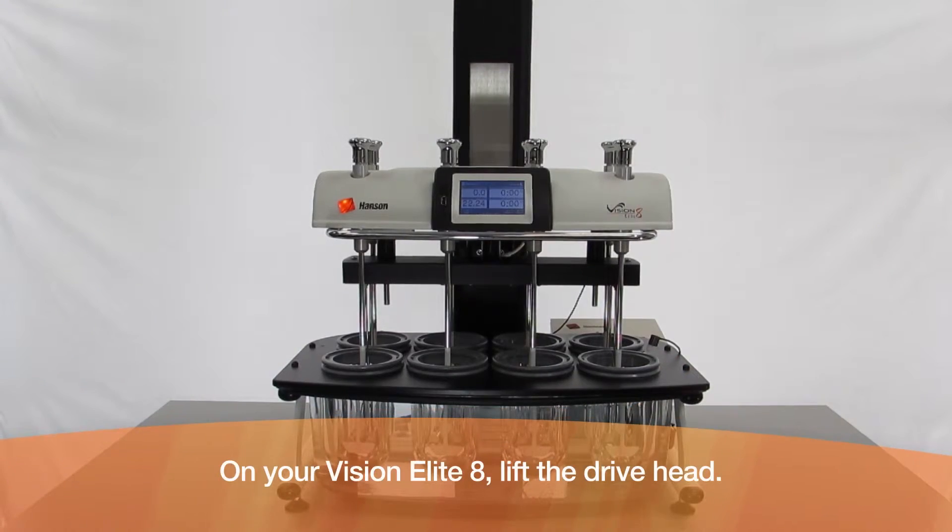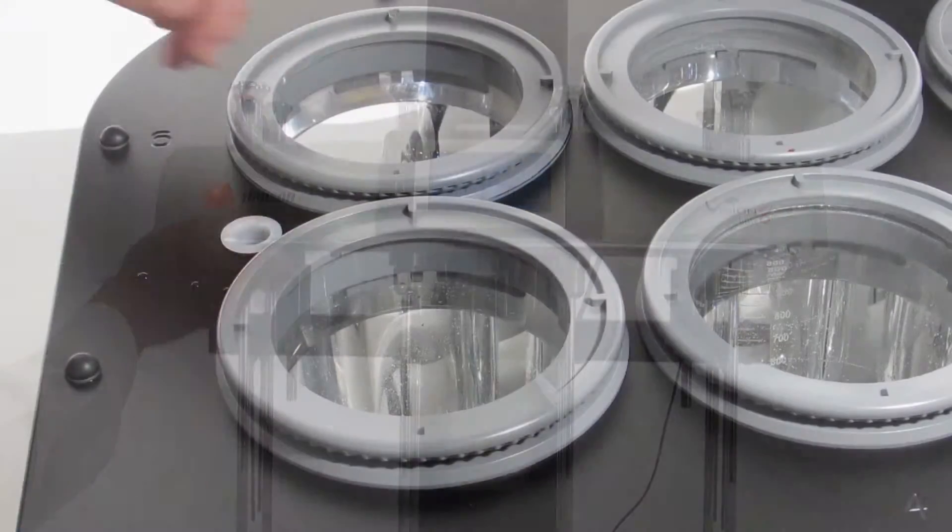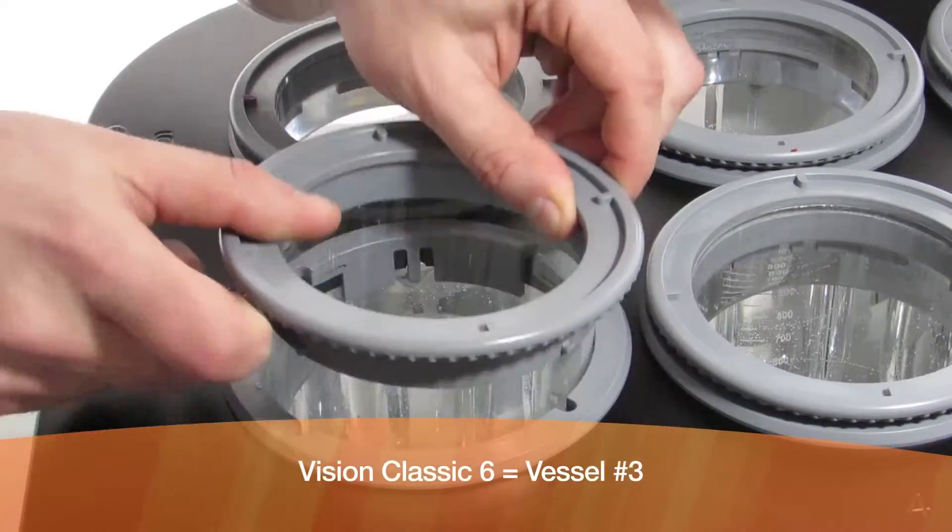On your Vision Elite 8, lift the drive head. Remove vessel number 5.